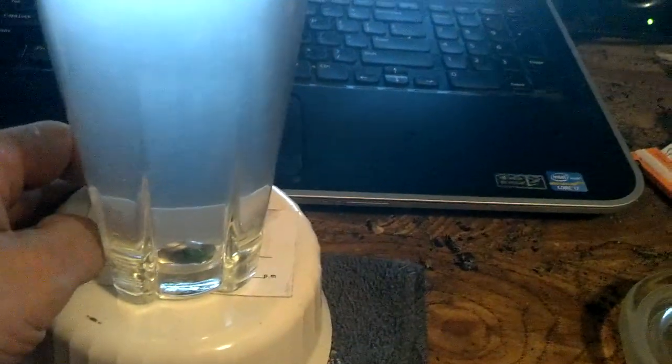The business card is simply there to keep the rattling down, so the fan is not perfect with the magnets mounted on it. It will make some noise. So to keep some of that down, I'm just putting a little bit of buffer systems in there. So we'll turn the voltage back on here.